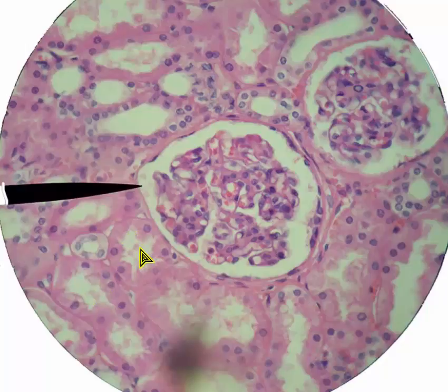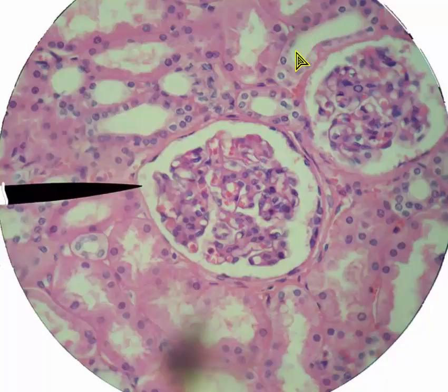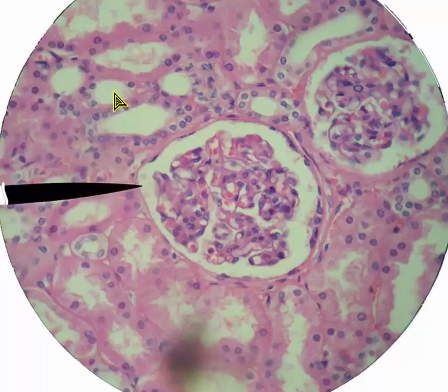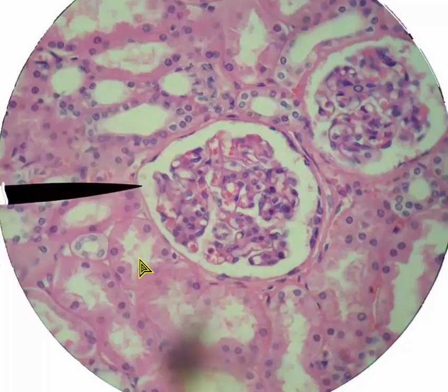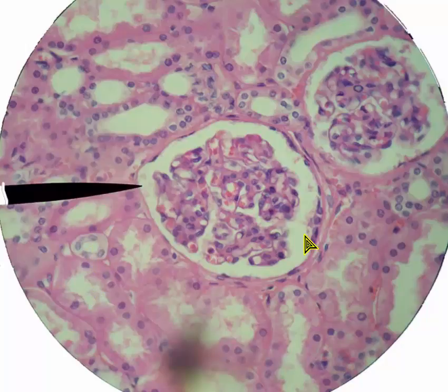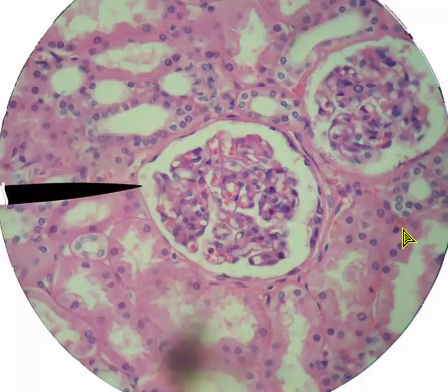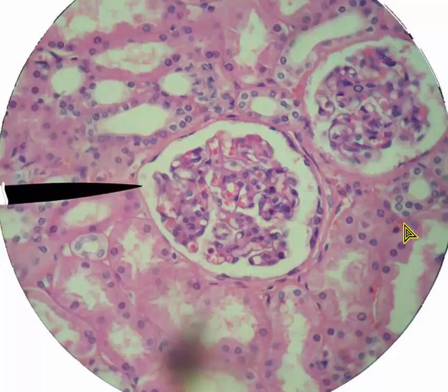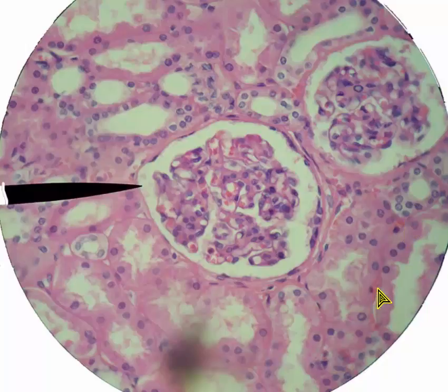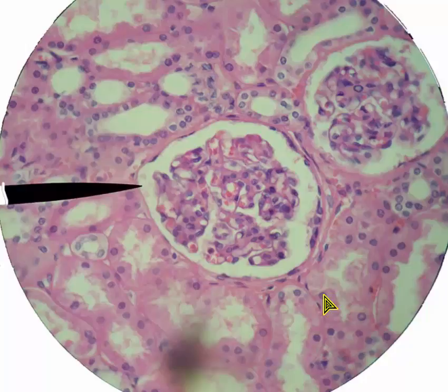Just in case you want to learn a little bit deeper: can you see how the tubules up here have kind of a smooth inside to them? Those are distal convoluted tubules. Whereas the ones down here — and it's interesting that the distal ones on this image are up here — down here we see proximal convoluted tubules, where it's more fuzzy inside of the tubule. They have microvilli on them. The other thing I want my students to know: can you see the reddishness here? Those are red blood cells, and they are inside of capillaries. Those capillaries are wrapping around the tubules, so we call them peritubular capillaries.